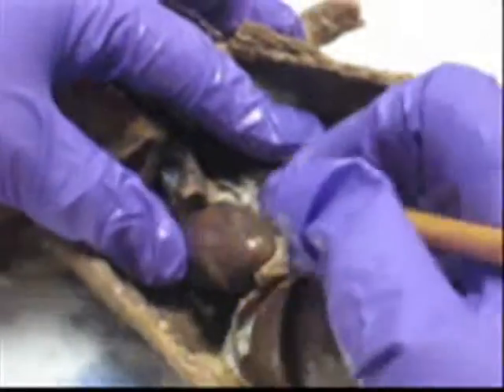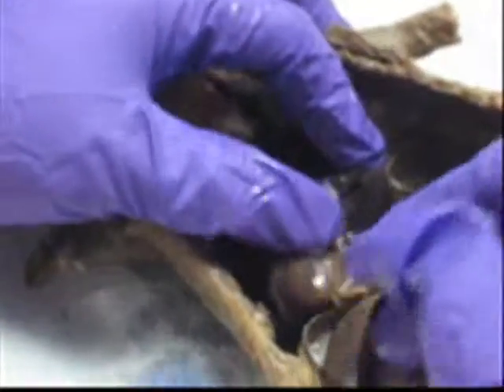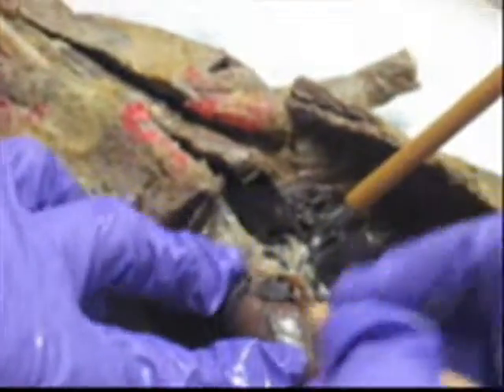Oh, nice. These are nice. Okay, look at this. Whose mink is this? Ours. Very nice. But you have to learn it in all the minks. This is nice to show.